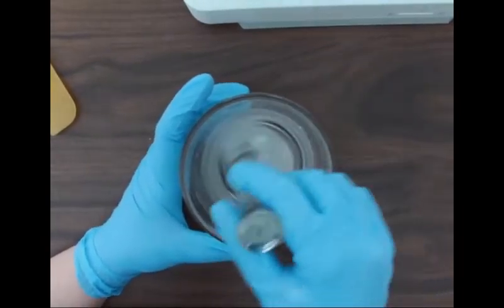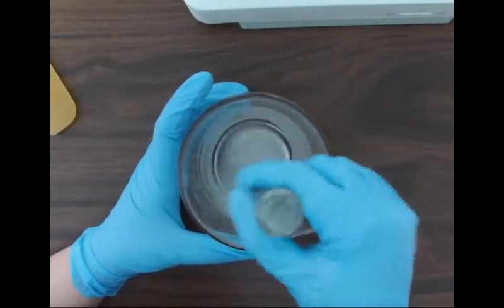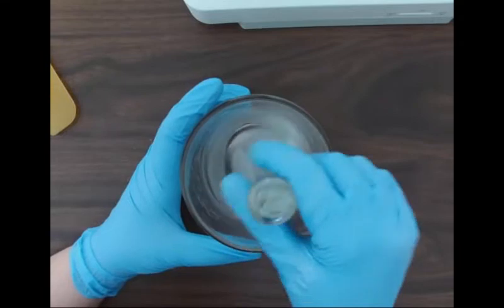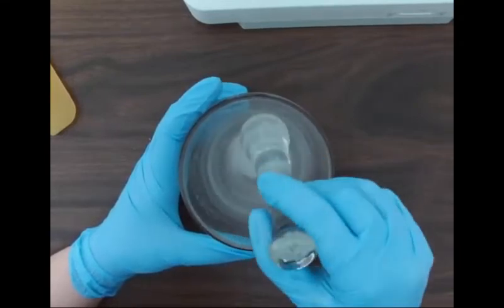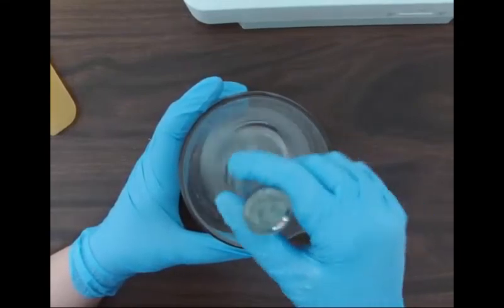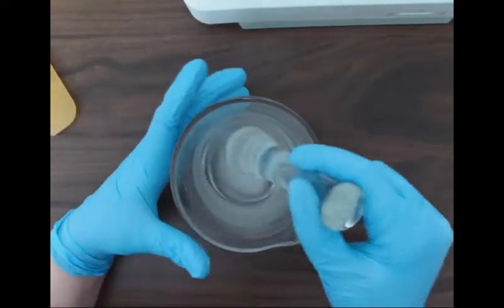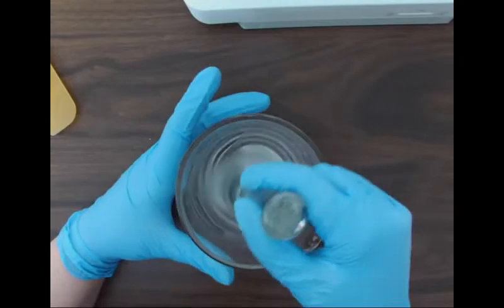So PLO has two parts. There's part A and part B. They're both liquids. When we mix them together, there's a chemical reaction that makes it go into a gel, but they all are going to start as liquids. So it's okay to just mix together, and we're not going to be worried about geometric dilution for this one.